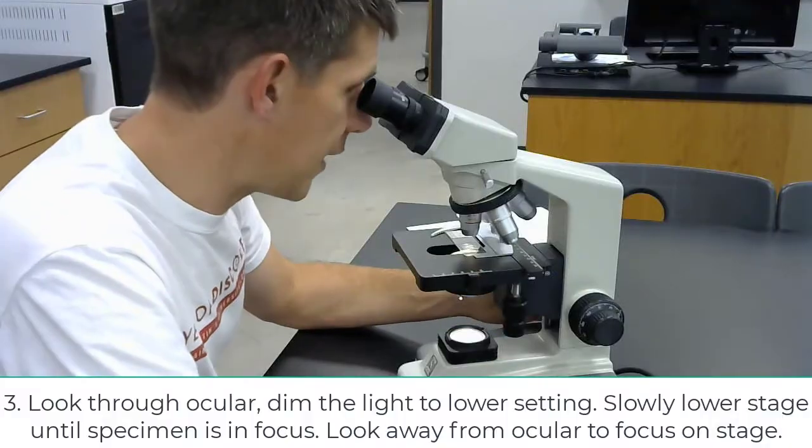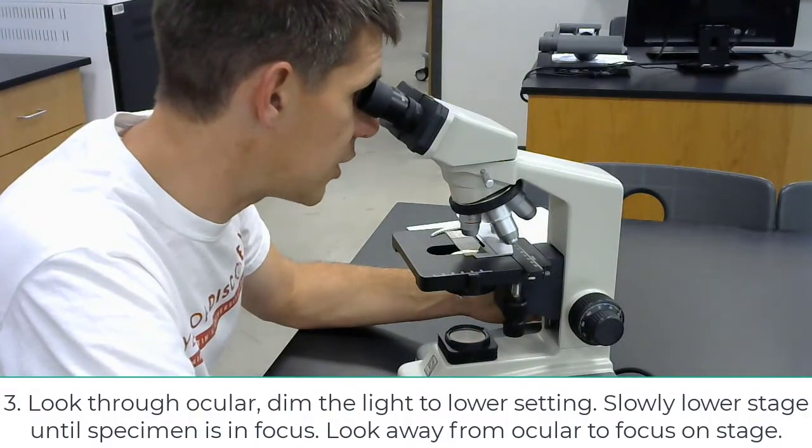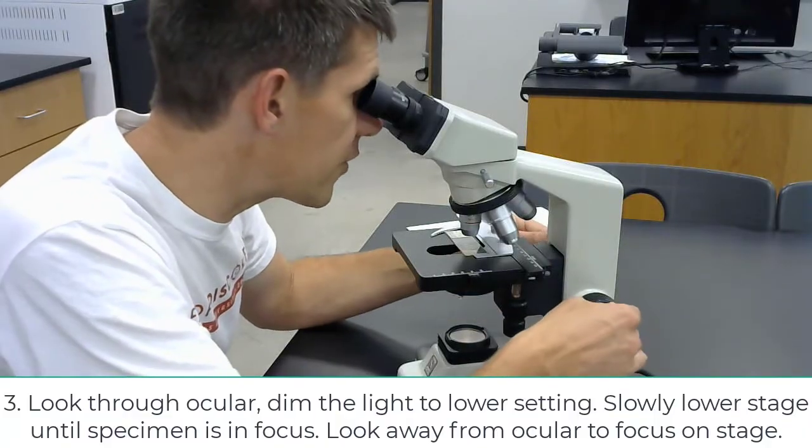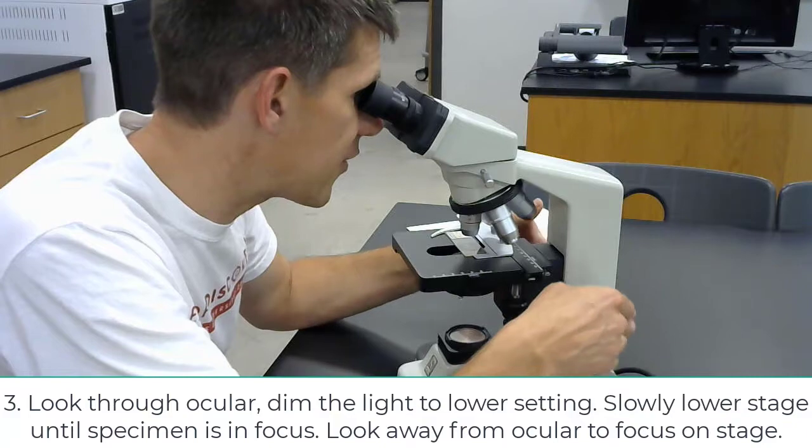Then I'm going to look through the ocular, and I'm going to turn the lights down low so I don't blind myself. Then I'm going to slowly lower the stage using the fine focus until I can see the specimen.